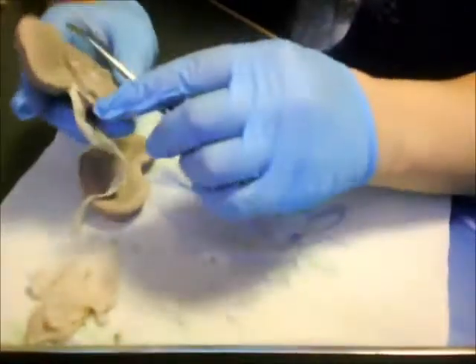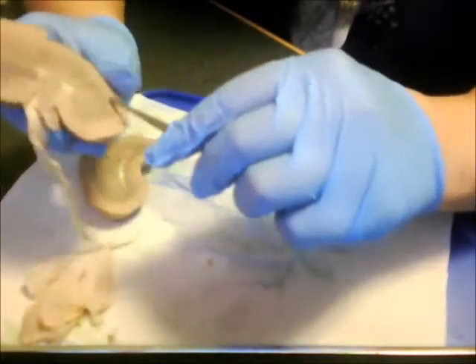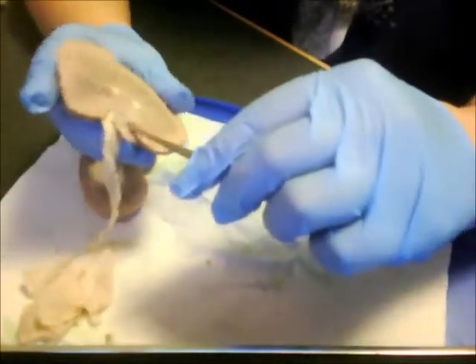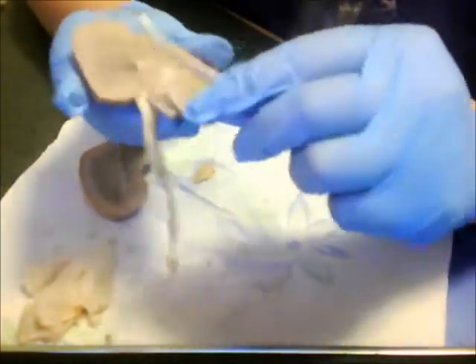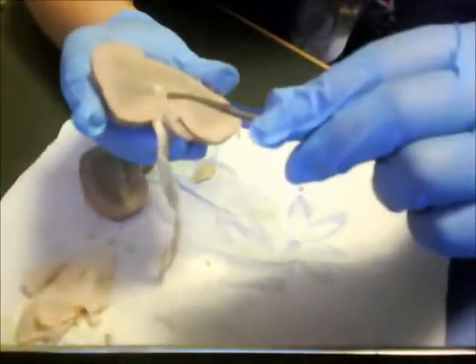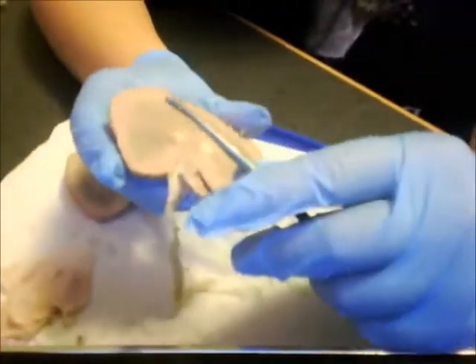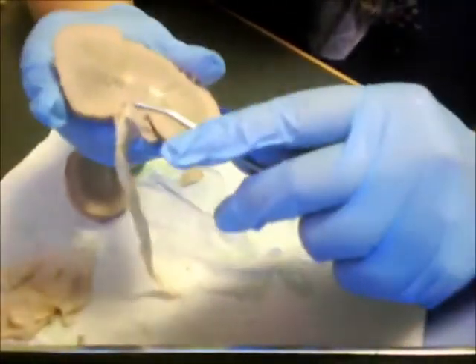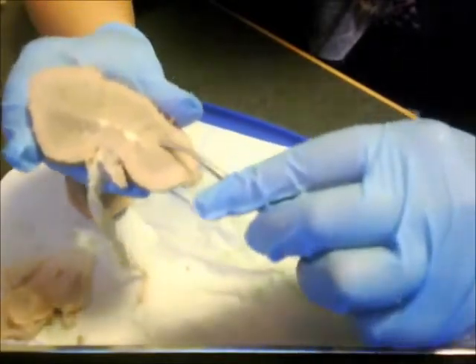I also read in my lab manual that the kidney cortex, it would be a lighter color because it is injected with latex. So what you will be able to see is predominance of red and blue and specks in this region, just so it's more predominant and you can see it easy. Okay, going upwards more, you'll have the renal pyramids of the kidney, and then of course the ureter.